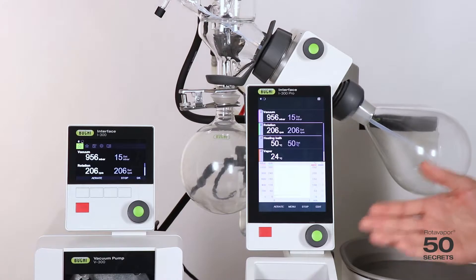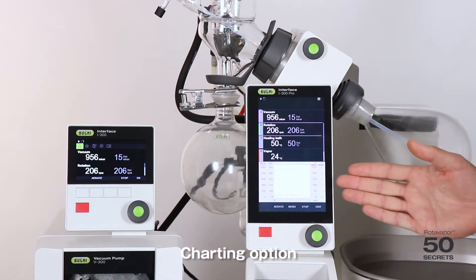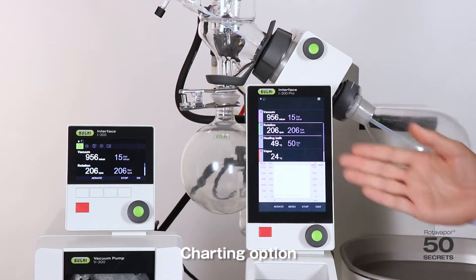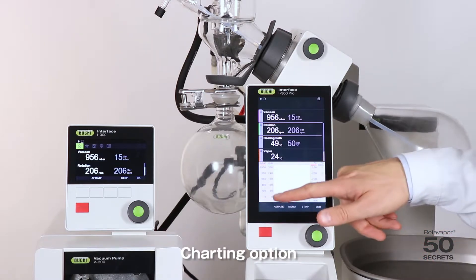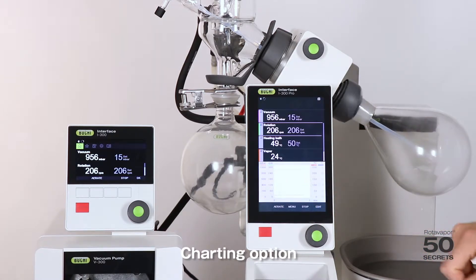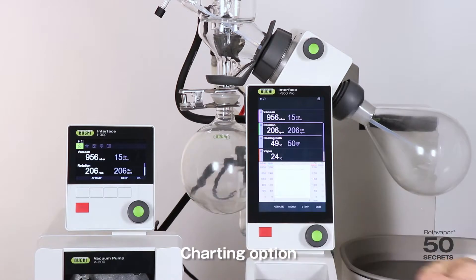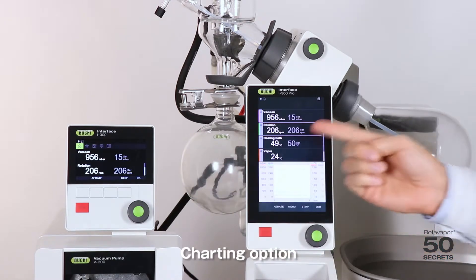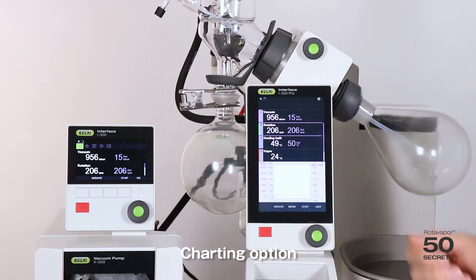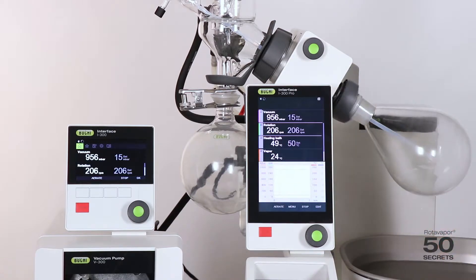The second obvious difference is this chart. You can see it very nicely when a distillation is running. For example, this one would be the rotation speed. On the i300 Pro there is this chart; on the i300 there is no chart. The same applies to the app.